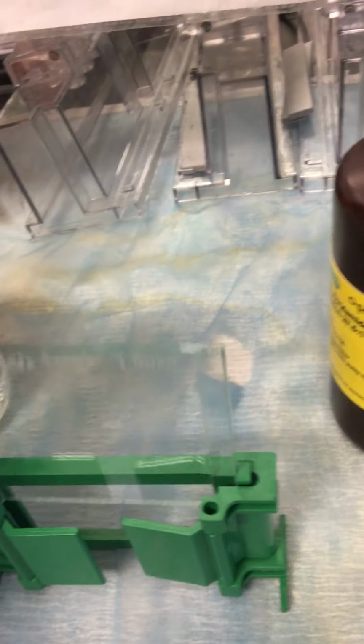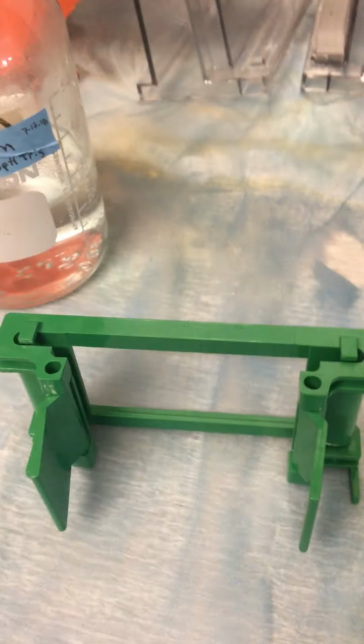And so then I actually do this, we've got the paper down there so that it absorbs wetness, but I usually take these over to here, because you really want these two glass plates to be very tight on the bottom with each other, and then you're going to close these flaps. So you'll notice if these flaps are closed, when you try to put the glass plates in, they're not going to fit. They're going to get stuck in there. So you put the glass in when they're open, and then you close them when the glass is in there.